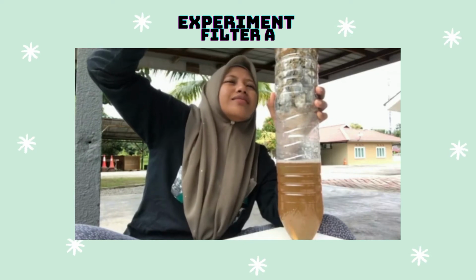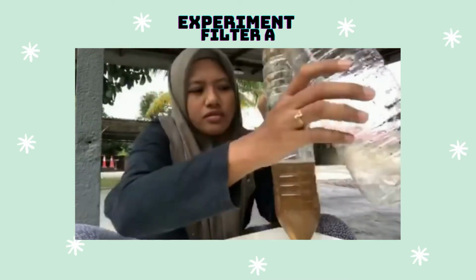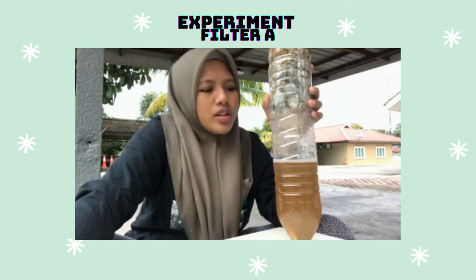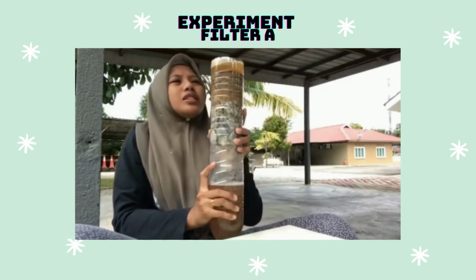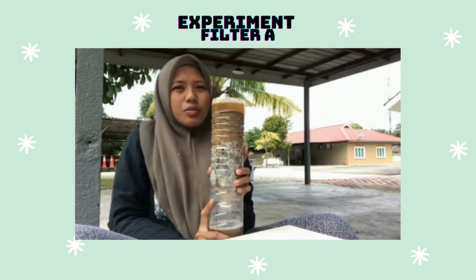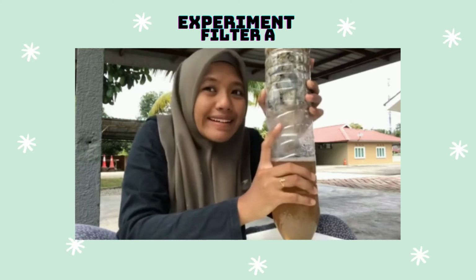Okay, empty. So we will wait until the water has totally gone through the water purification system. After that, we will observe the parameters.